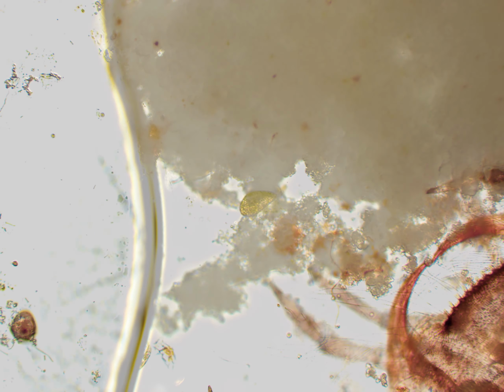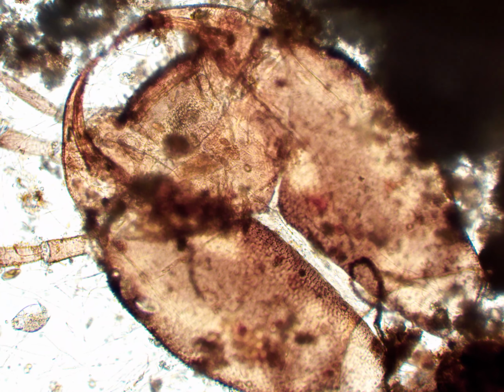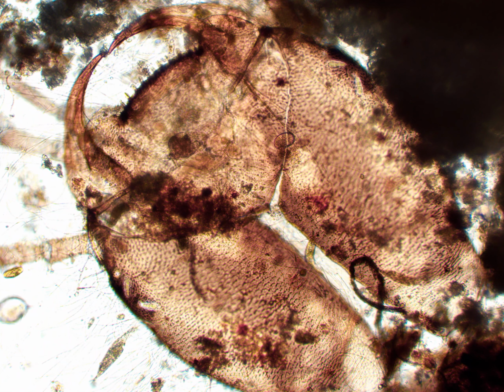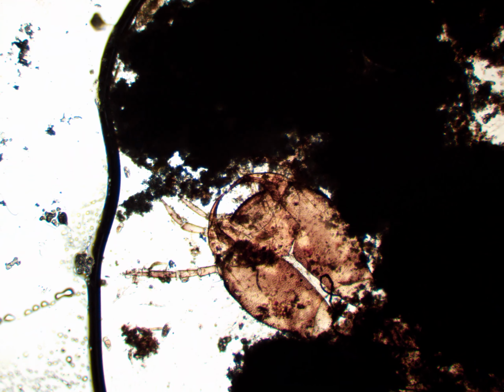It has endosymbiotic algae called zoochlorella. And that is the head of this mosquito larva. You can see a rotifer and some Uroleptus around it, which I will get to later. You can see that ostracod again there.